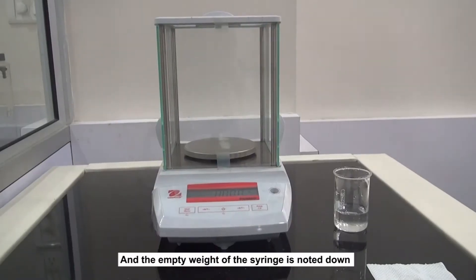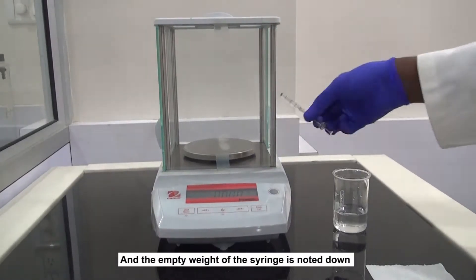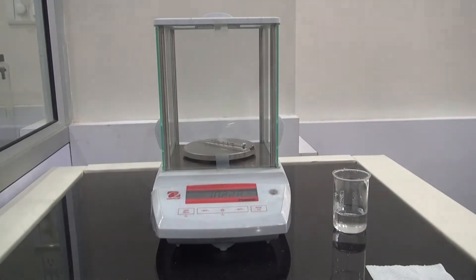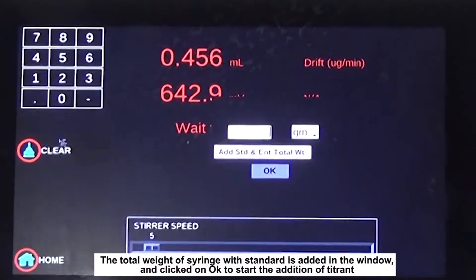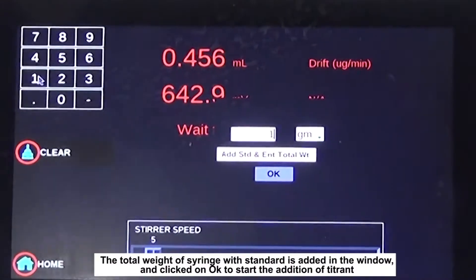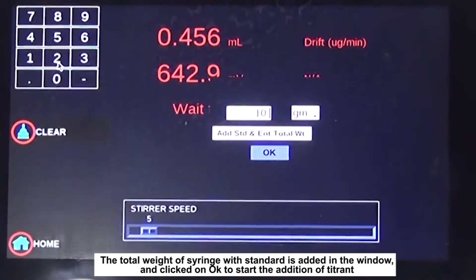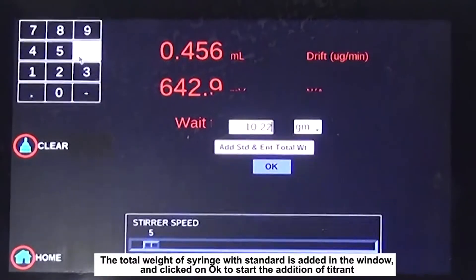The empty weight of the syringe is noted down. The total weight of the syringe with the standard is entered in the window and OK is clicked to start the addition of the titrant.